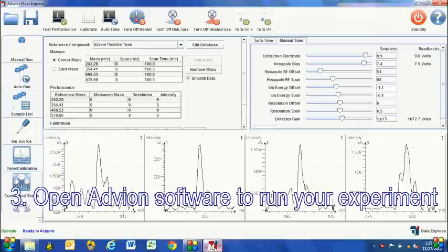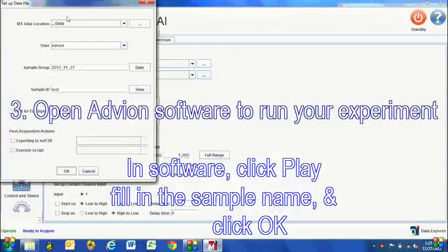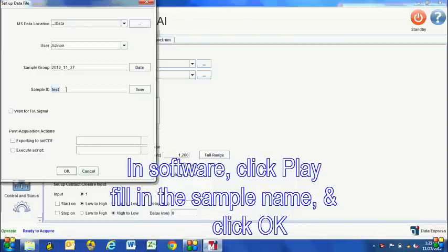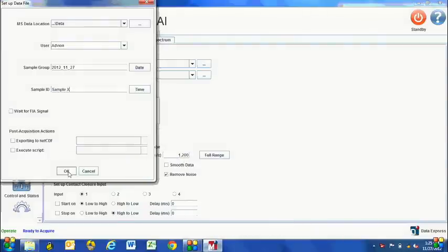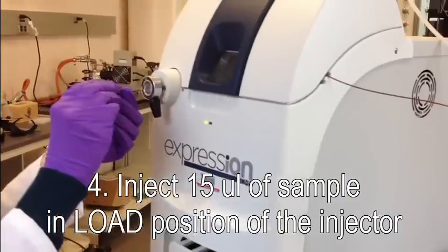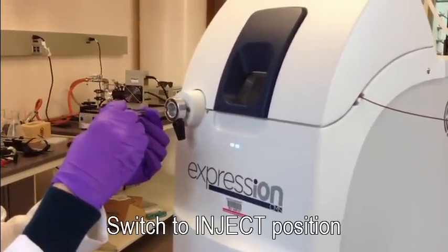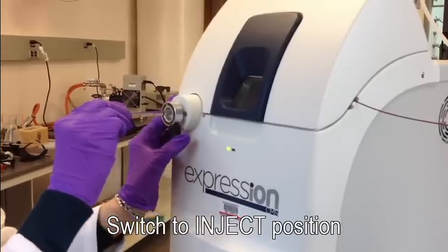Acquire data using the Mass Express software. Inject your sample into the Expression CMS. Once you have injected your sample, switch the valve to the inject position.